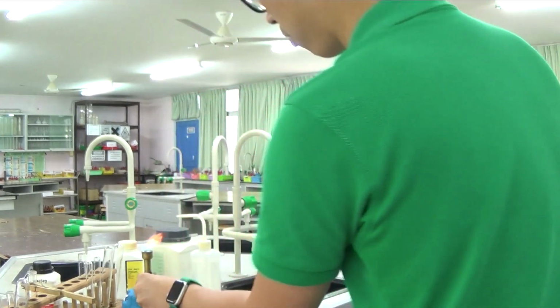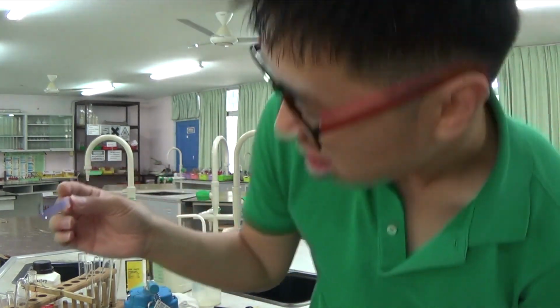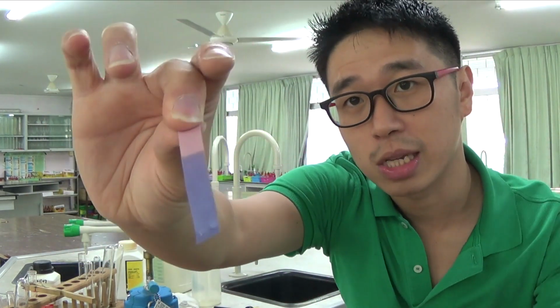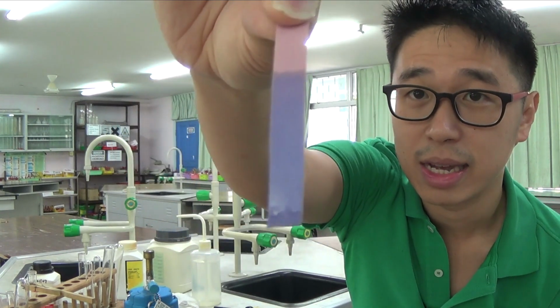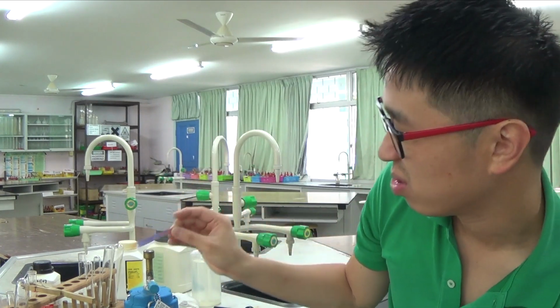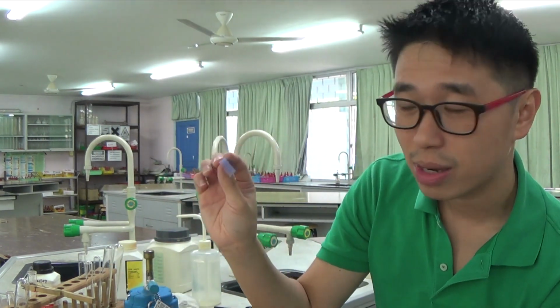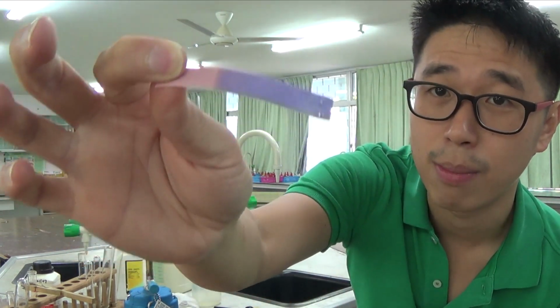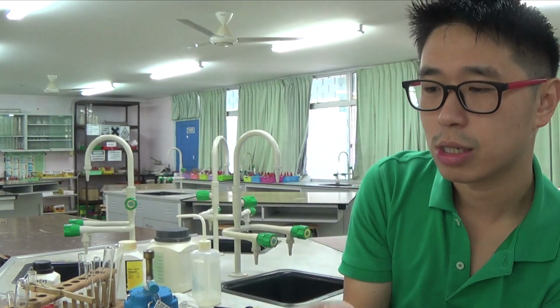I closed my Bunsen burner first, that's the important thing. Always be safe. By not inserting the aluminium foil, I just added sodium hydroxide, and I made sure that the sodium hydroxide was added in excess, and there's a reason for it. I'll tell you in a little bit. First of all, I have confirmed that ammonia is present, just by reacting.